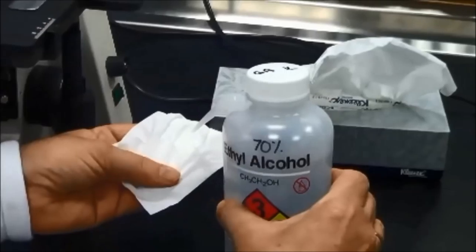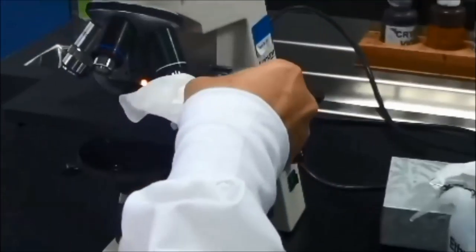When finished, remove the slide and clean the 100x lens of any oil using a tissue soaked in 70% ethanol.